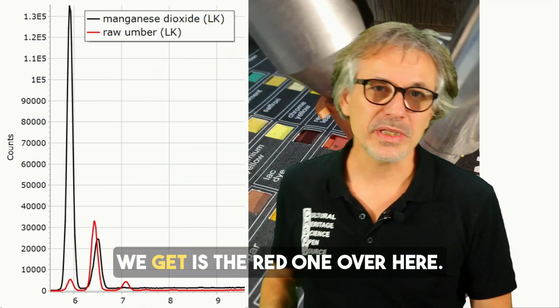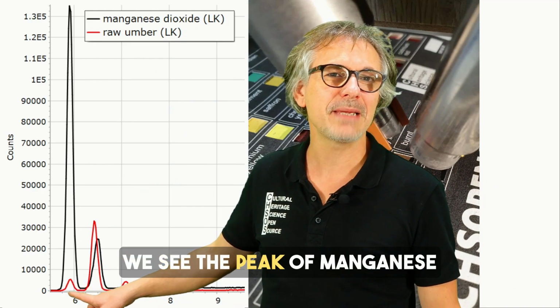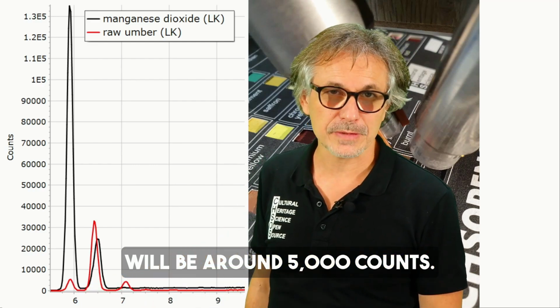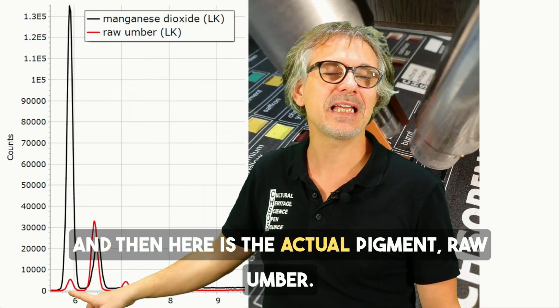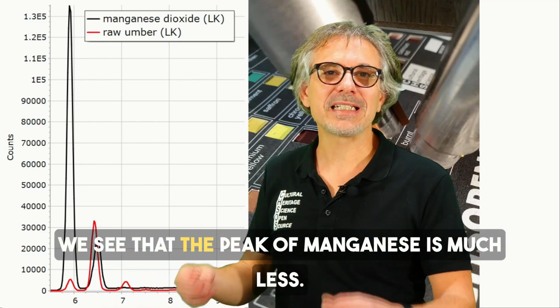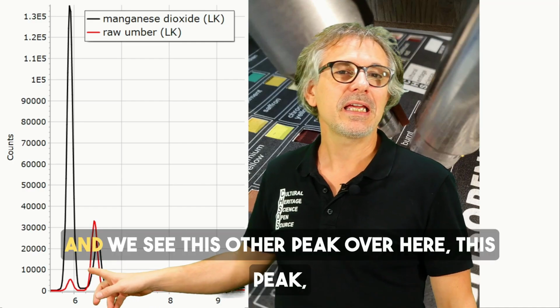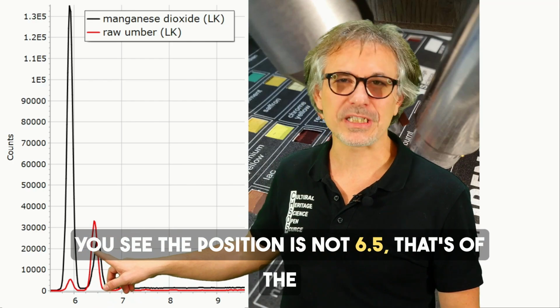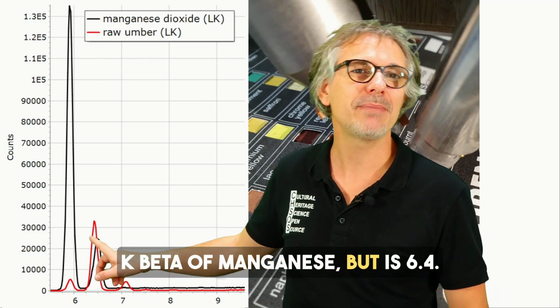Let's examine now the raw umber, in the pigment checker standard version. The signal we get is the red one. Over here we see the peak of manganese will be around 5,000 counts. Compare it with pure manganese dioxide, and then here is the actual pigment, raw umber. We see that the peak of manganese is much less, and we see this other peak over here.